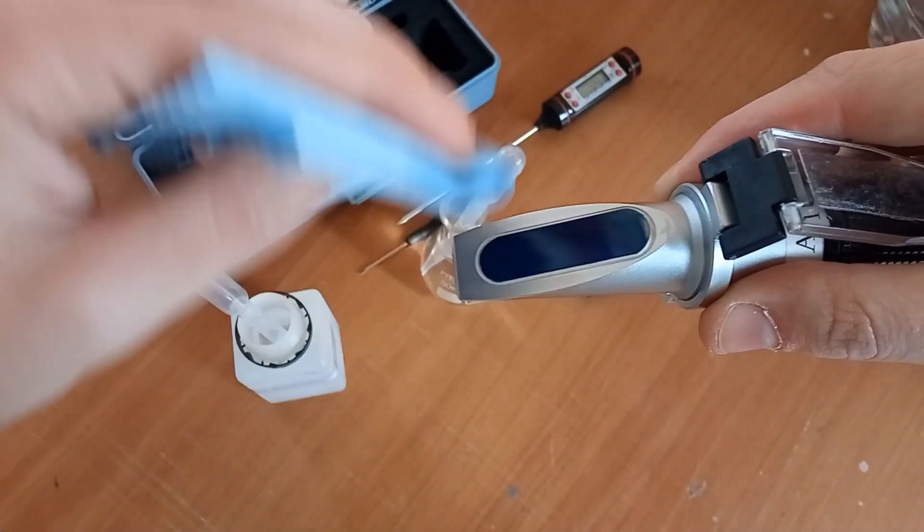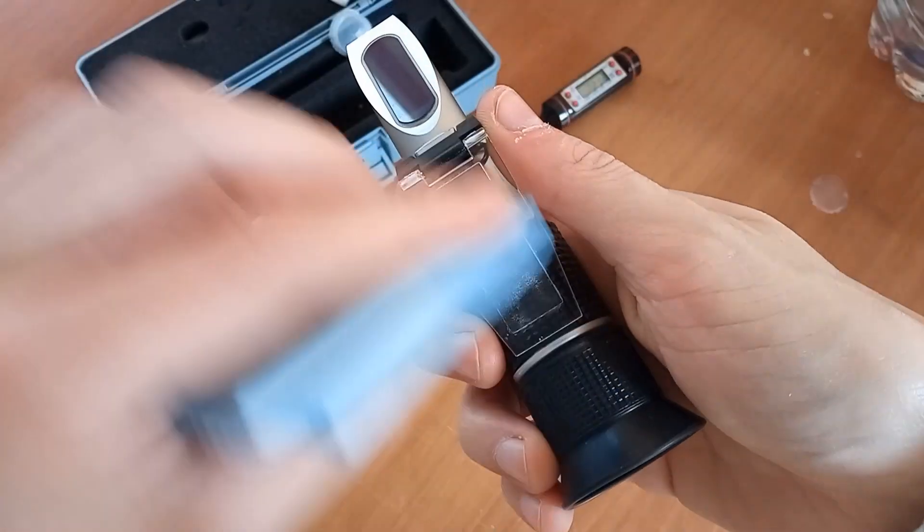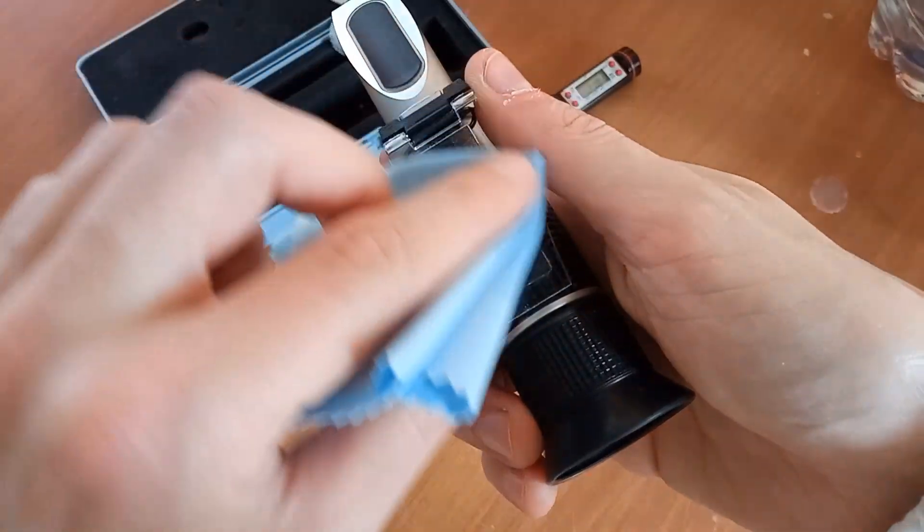Acids, bases, corrosive liquids cannot be used or measured. Some solvents can give swelling or damage plastic cover either.